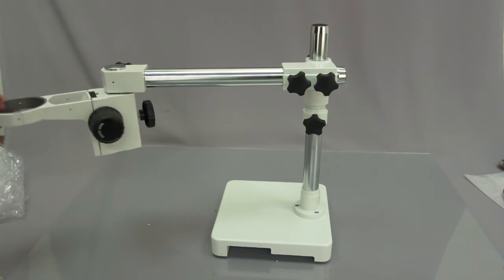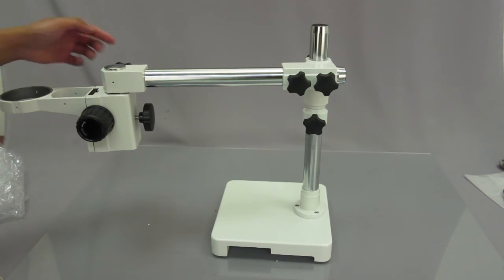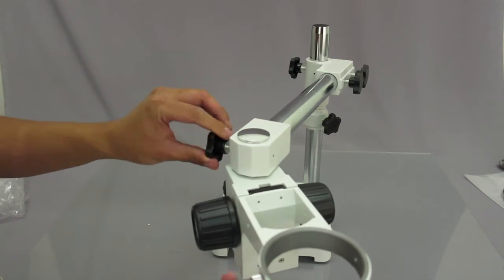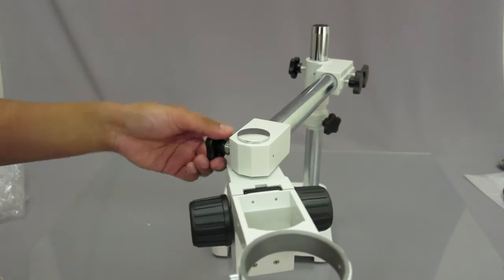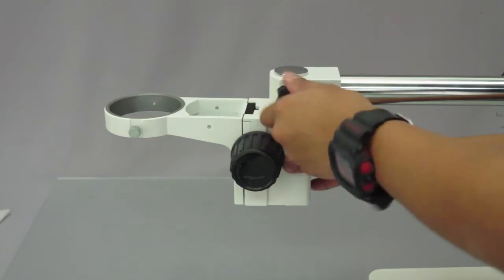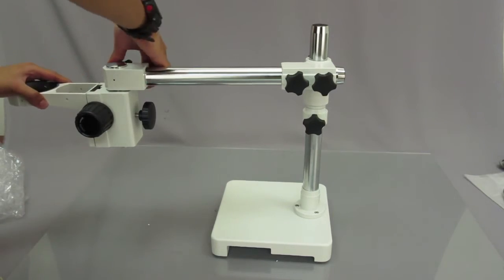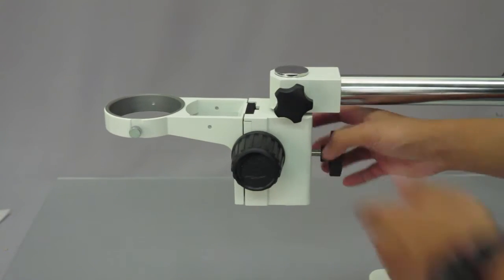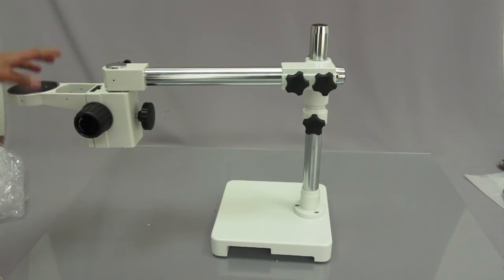Now that you can see it's in, this could swivel around. If you wanted it to stop doing that, there's another knob right behind here. I'll swivel this around so you can see. This knob right here stops the focusing rack from moving. So I'm going to go ahead and tighten it. And I'm also going to tighten this right here. And that will stop the focusing rack from swiveling left and right.